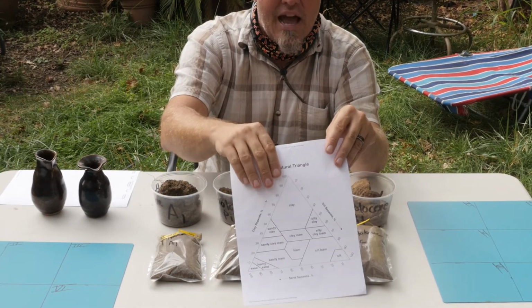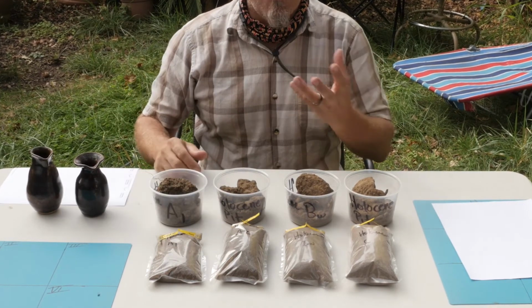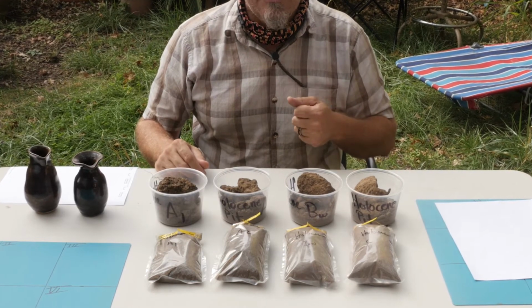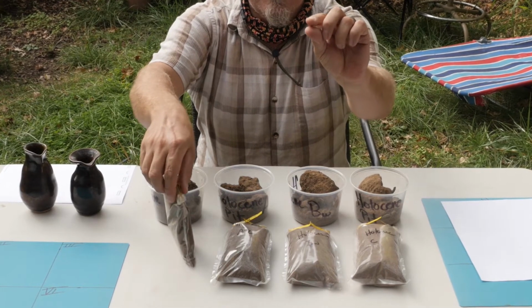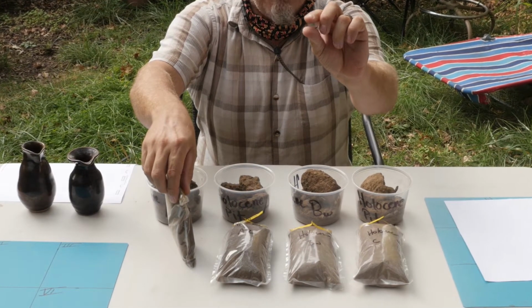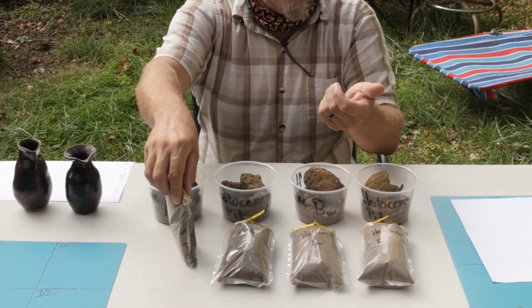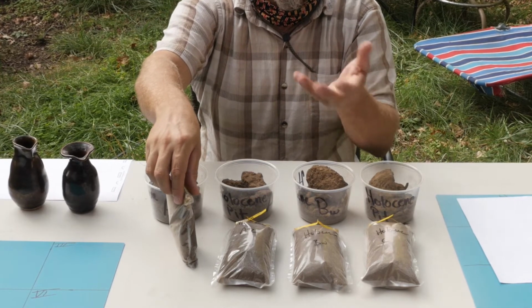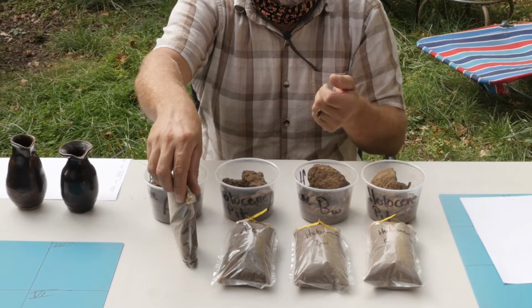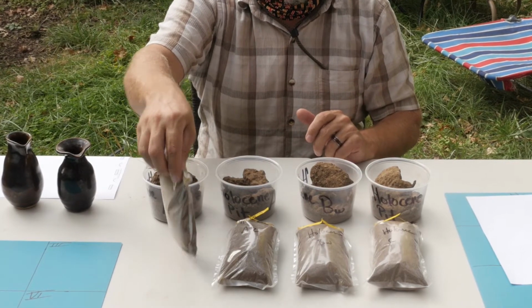How are we going to do that? Well, first we're going to take soil and water and we're going to work it up into a textural ball that will allow us to use our very sensitive pressure meters in our fingers, along with thinking about grit, plasticity, stickiness, and some other morphological or physical features, and allow us to understand generally what classification the soil is.